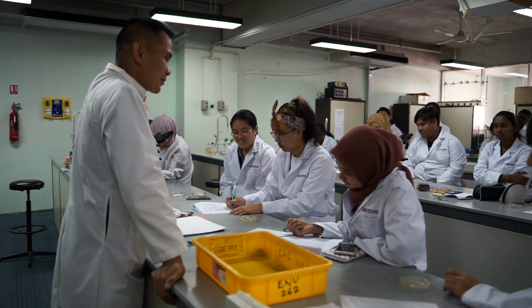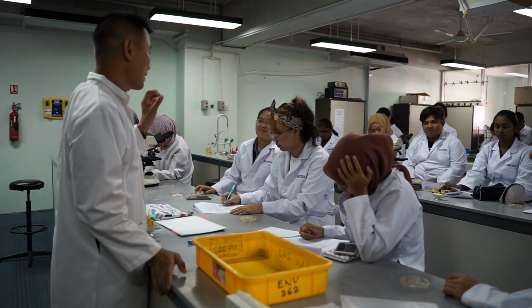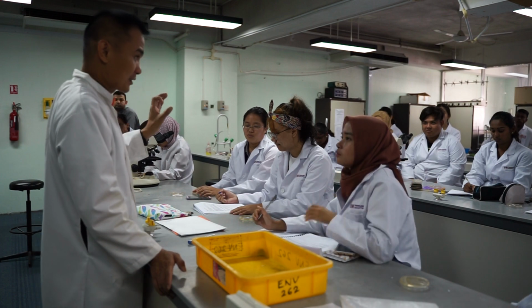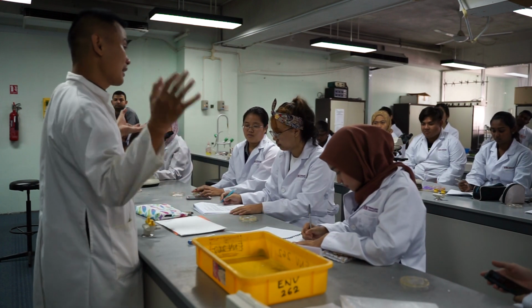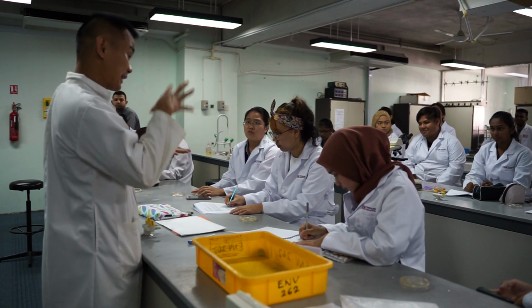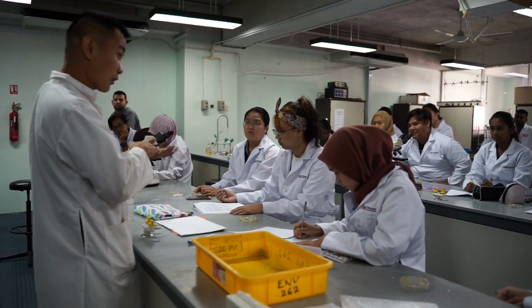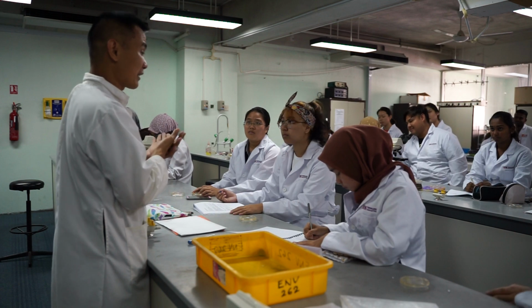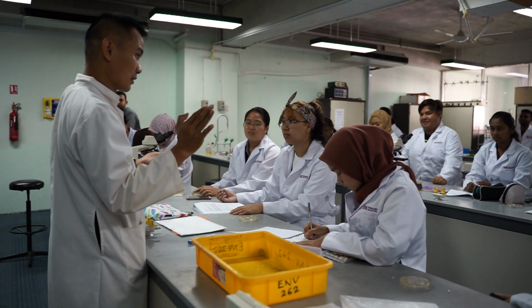I want to see if you understand. I'm going to repeat the process again. The question is, if the cell wall is thick, is it going to be blue or red? Listen to the process. First, you put crystal violet. The color goes in, and then you put iodine to stick the color onto the cell wall. And then you wash using alcohol. If the cell wall is thick, the alcohol will never be able to go in and wash the color out.